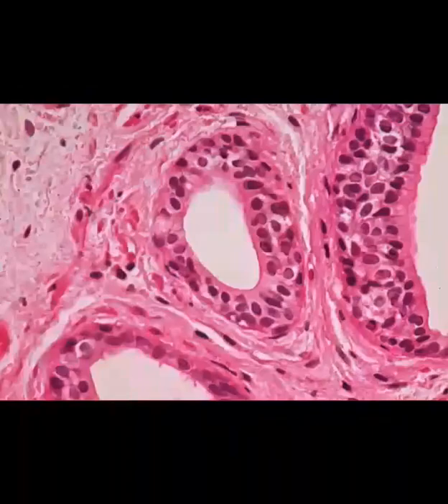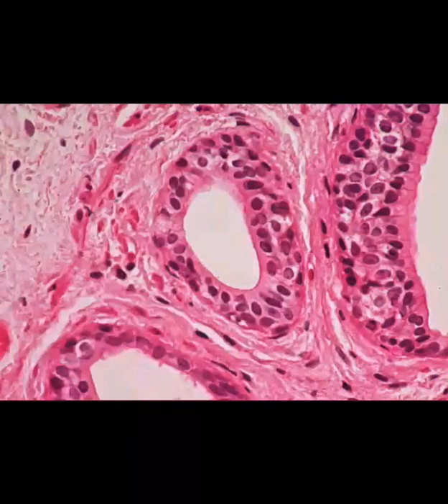So this next slide is a sweat gland, and in that tubule there in the middle, we are seeing that it's lined with multiple layers of cells, so it's stratified. And the nuclei in there are somewhat circular. I know it's kind of hard to tell with some of them. They look stretched out, but the cells are cuboidal cells, and so we have stratified cuboidal epithelial tissue lining the tubules within the sweat glands.